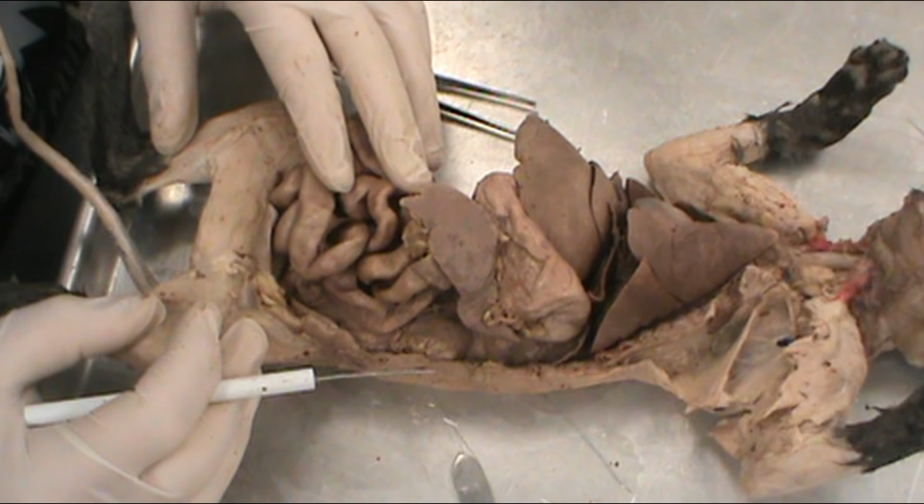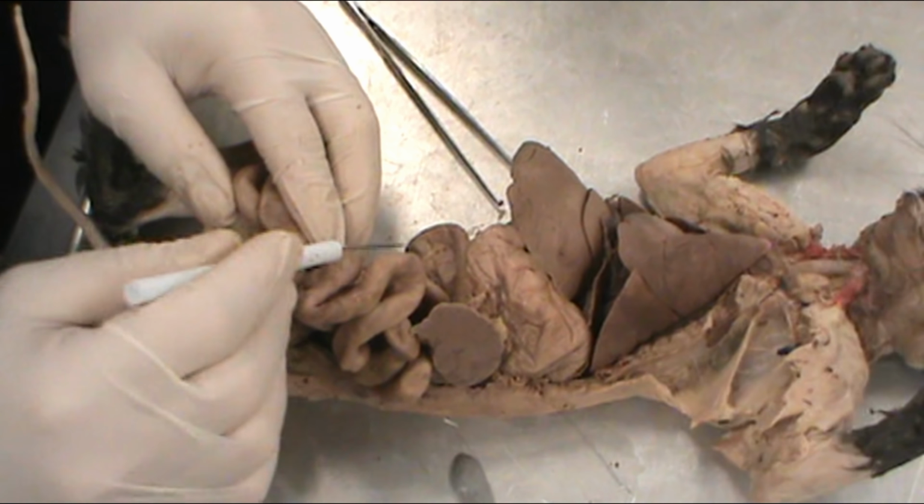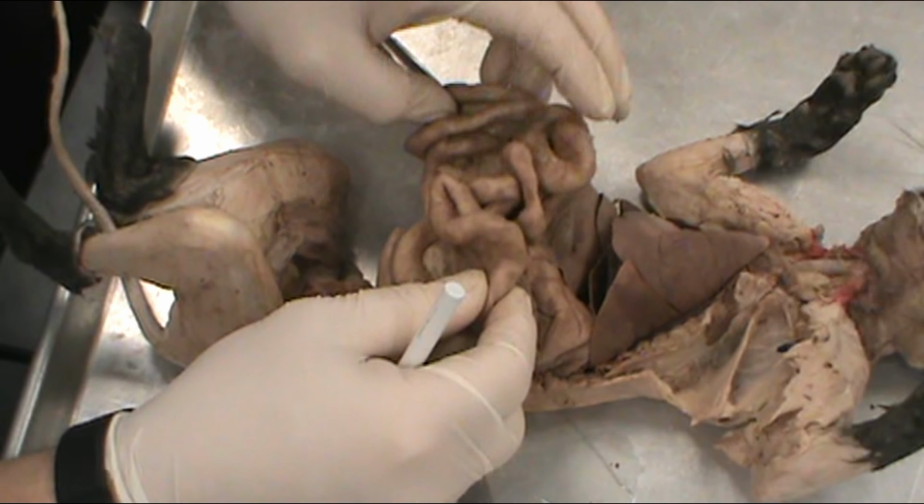That'll be another one. So when I go to pin that one, it'll be tricky because the pin will go right through it as I am anchoring the pin into a different body part. So remember, when I'm looking for something, I will give you the direction that the first thing the pin goes through is what I'm after. So if I pin right through here, I'm looking for the mesentery. Even though the pin may stick into a different organ to keep it still, that's what I'm looking for.